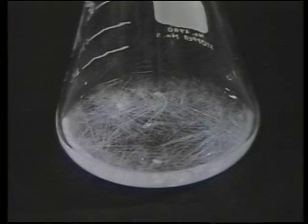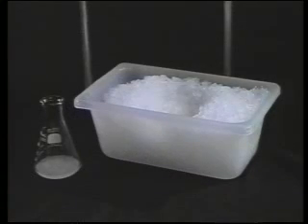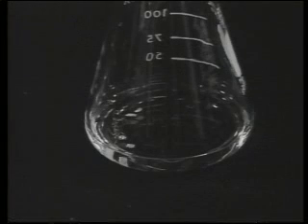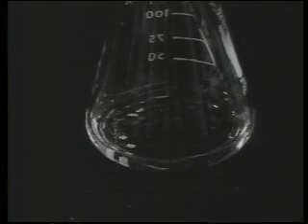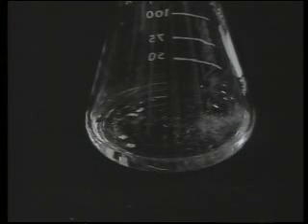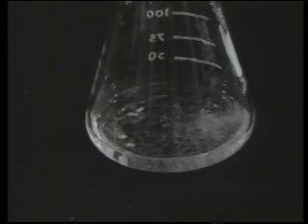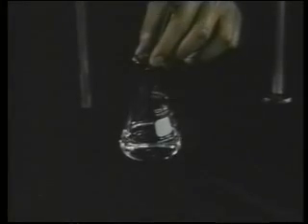Wait until the majority of crystals have formed at room temperature, then place the flask in an ice water bath. But what do you do if no crystals form, when the flask is on the bench or even after longer cooling in an ice water bath? In this situation, you must induce crystallization by nucleation. Scratch the surface of the flask with a glass rod to provide small pieces of glass around which the crystals can grow. Another method is to seed the solution with a crystal of pure compound if one is available. If neither of these methods work, the solution should be concentrated further.